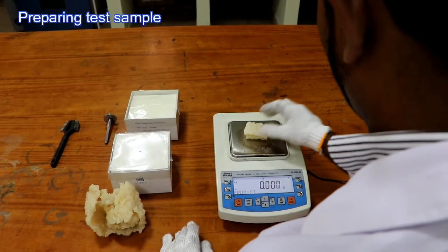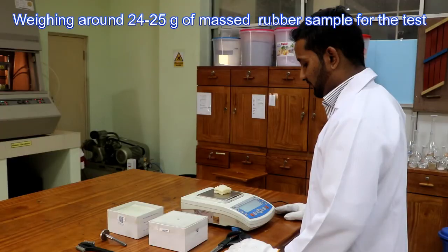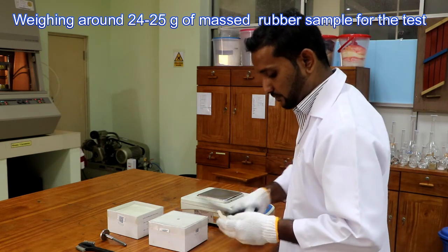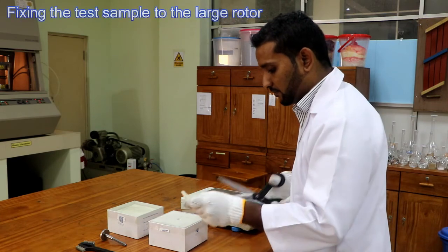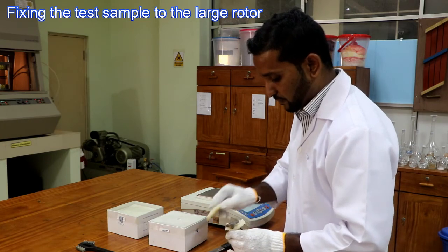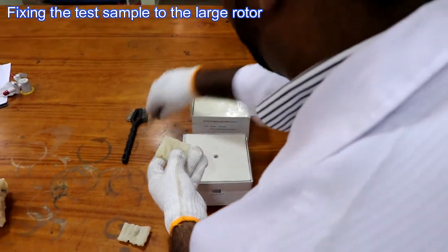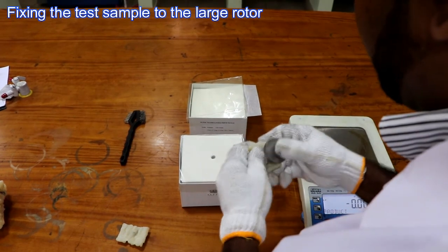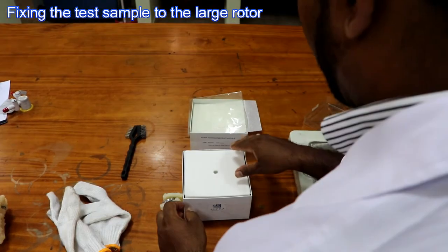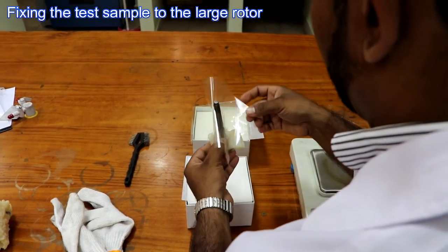To prepare the test sample, weigh around 24 to 25 grams of massed rubber sample for the test. This is how we fix our rubber sample to the rotor — here it is the large rotor. After fixing the two rubber samples, we have to place two polyester sheets at the bottom and top of the rubber sample to avoid the stickiness of rubber to the surfaces of the cavity of the Mooney viscometer.